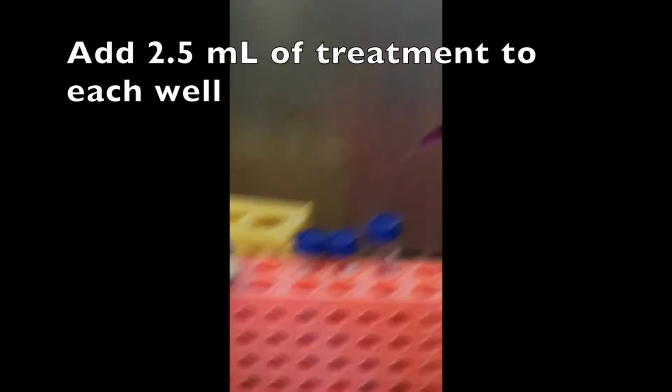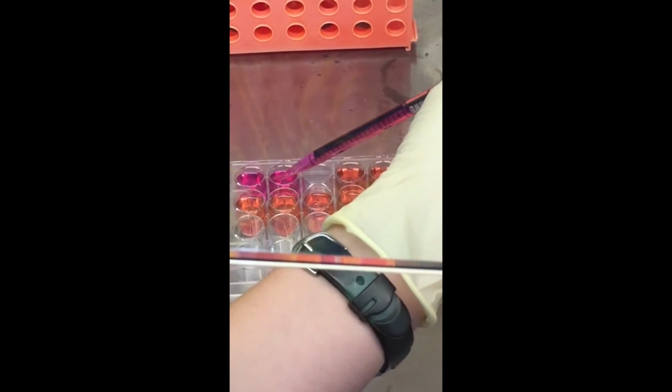Okay, so this part is important. When you're letting the media out, make sure to gently touch the edge of the well and then slowly release the liquid. This makes sure that you're not knocking off the cells in the bottom of the well. Okay, and then move on to the next group.